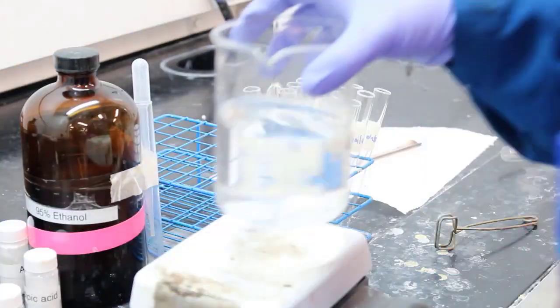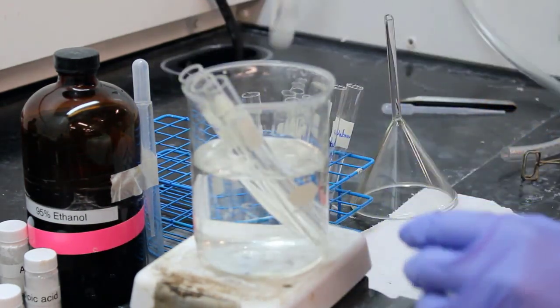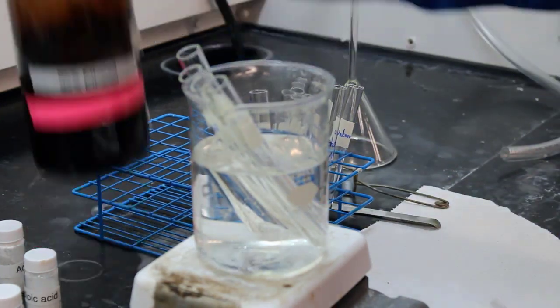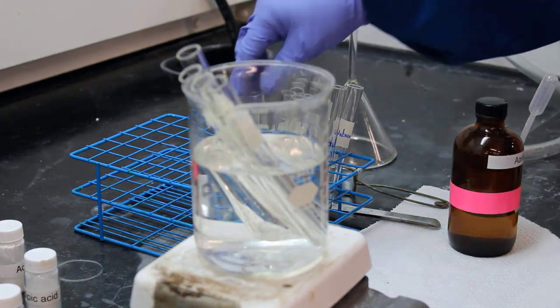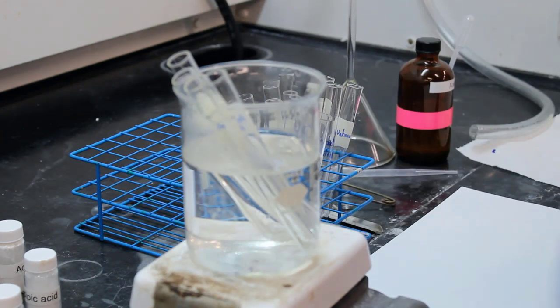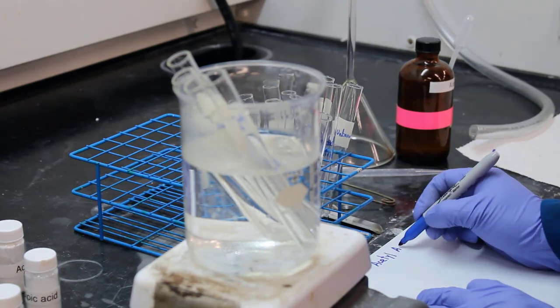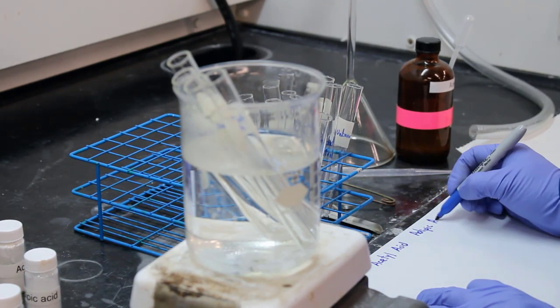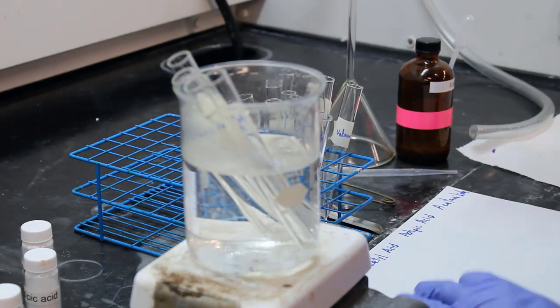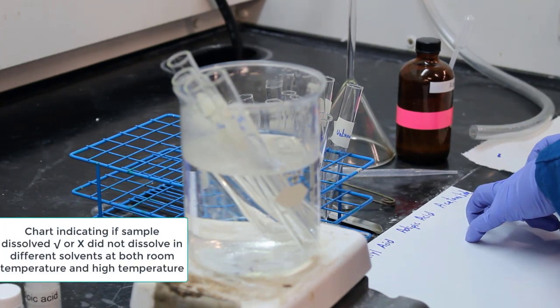Alright. And now they're setting up the hot plate. They're going to heat up water so that they can add tubes 2, 3, 4, and 5. They're doing that because those test tubes, containing acetanilide, adipic acid, acetylsalicylic acid, and the unknown, did not dissolve at room temperature in ethanol. The only one that dissolved was salicylic acid. Now they're going to allow this beaker of water to warm up, and then they're going to test another set of compounds with acetone.